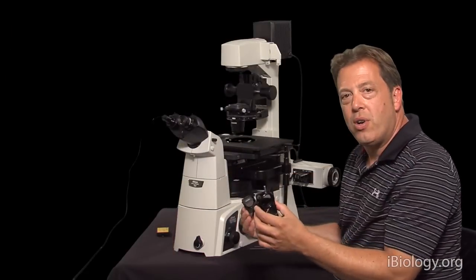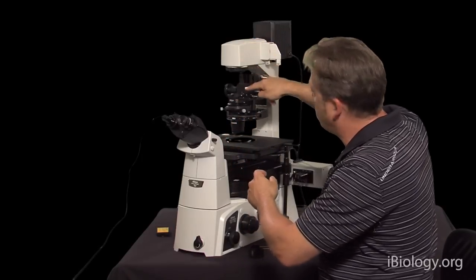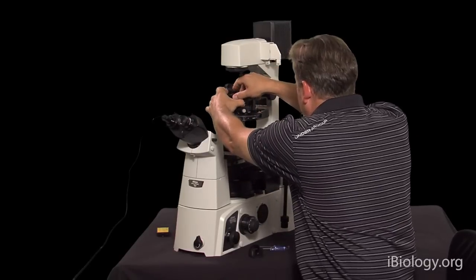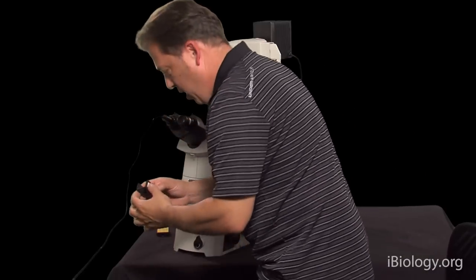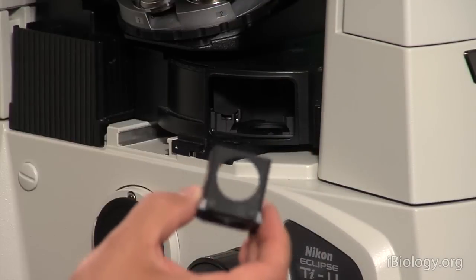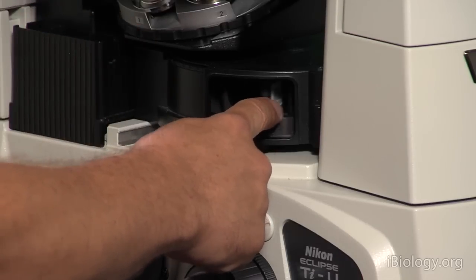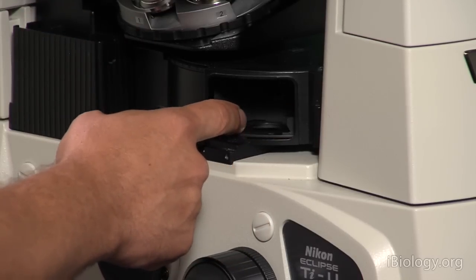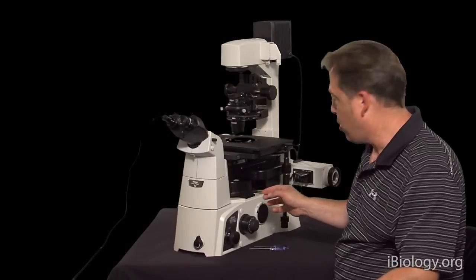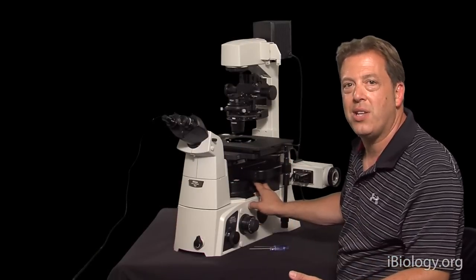The polarizer sits in the transmitted light path on the microscope, which we've covered in previous lectures. The analyzer, our second polarizer, sits in the microscope — it actually goes into our fluorescence filter turret, clicks in place, and then two clicks to the left puts it in our light path. Having the analyzer in the fluorescence filter turret allows you to do multi-dimensional imaging and switch between DIC and fluorescence imaging.